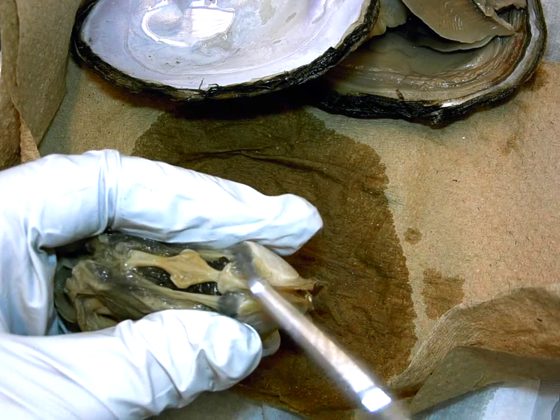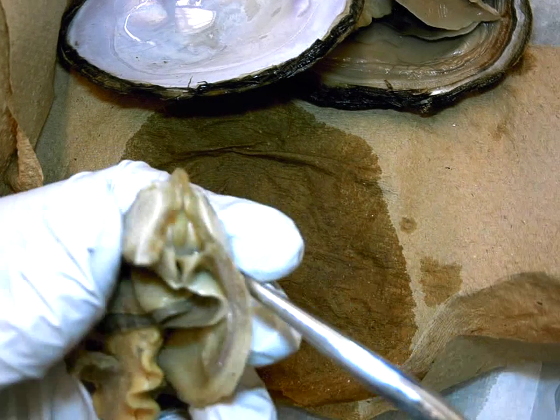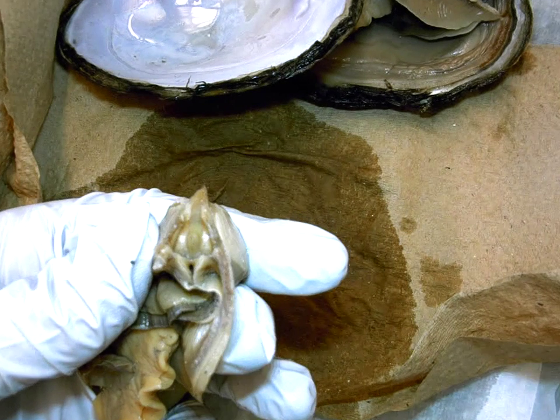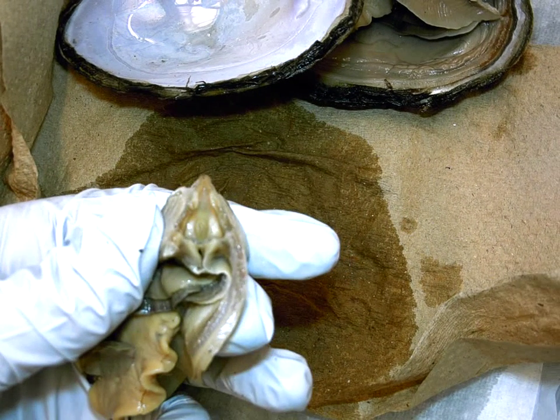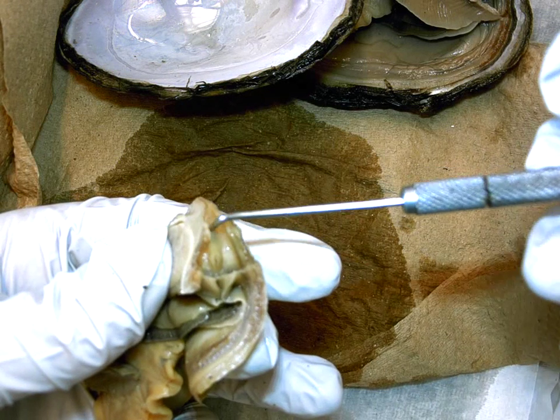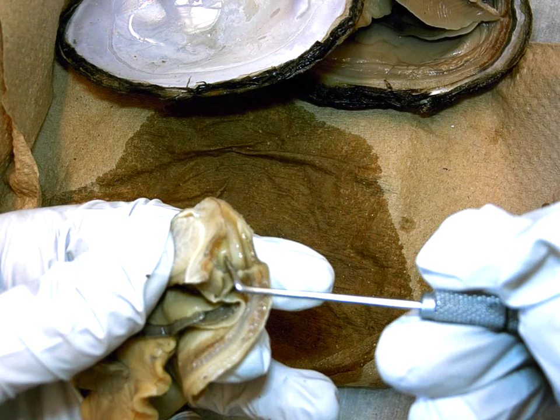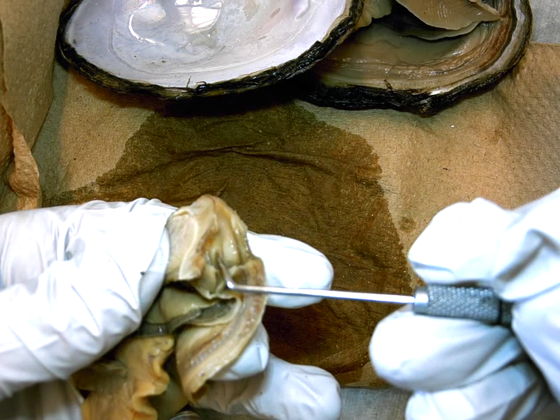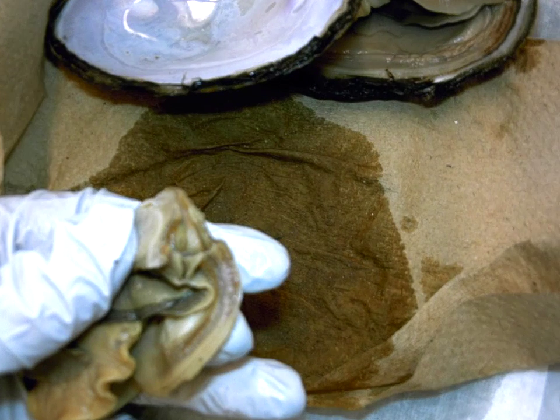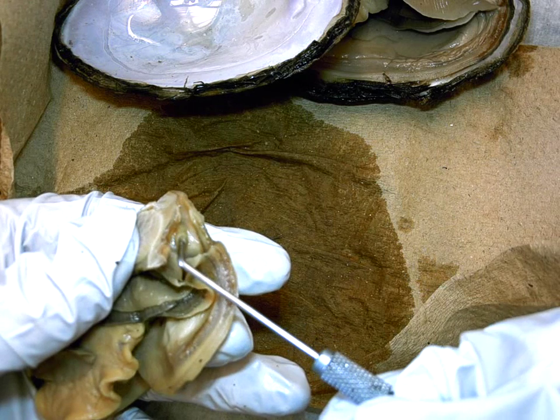As we follow this tube around the big adductor muscle, what we can see if I turn the animal, let me adjust my focus here, is that at the very end of the animal this tube continues, and right here we see an opening. And this opening of this tube right there, let me focus again, that little opening is the anus of the digestive tract.